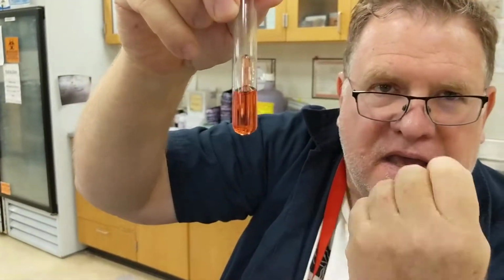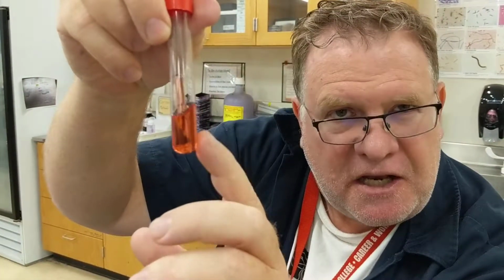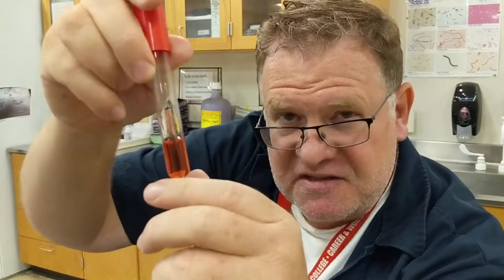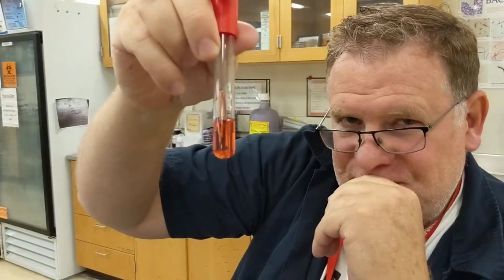This media is going to have relatively few nutrients inside of it, some amino acids and so on. But on all these medias you can switch the sugar, the carbohydrate that they use. This particular one has glucose inside of it. If the bacteria can grow and use glucose, it's going to produce some acids and possibly some gas. How can we tell that? Is this a selective or differential media? I want to say selective. Not really. It's used as a differential media, but it can be used as selective. But your answer was right.